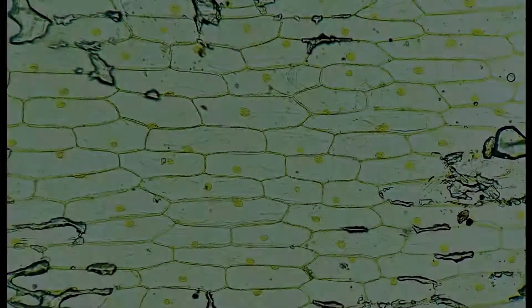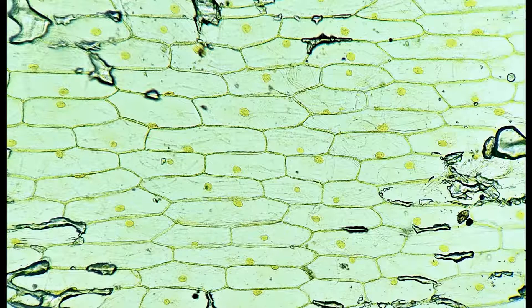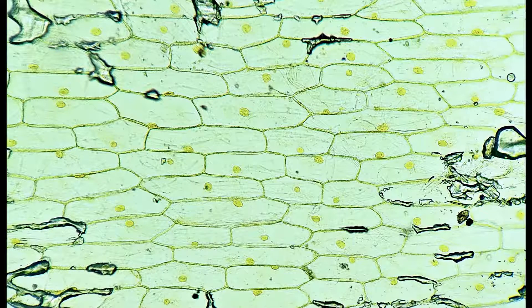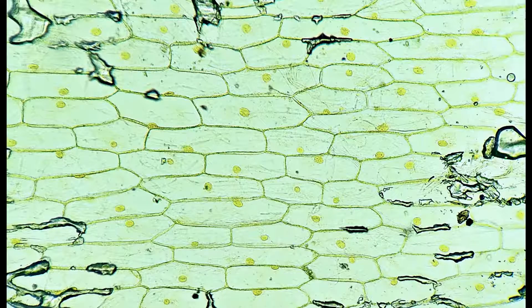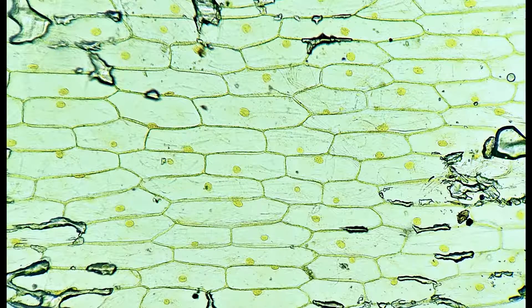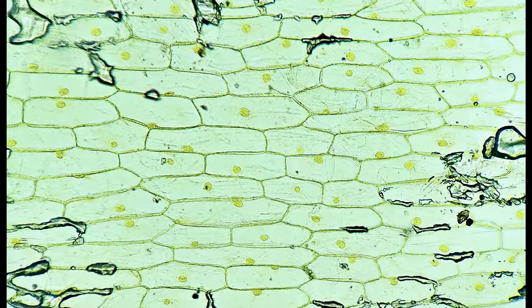In this video, we'll be preparing a temporary stained slide mount of a eukaryotic plant cell and make a rough study of the various parts of the cells that are discernible under the compound light microscope. For this experiment, we'll need the following.